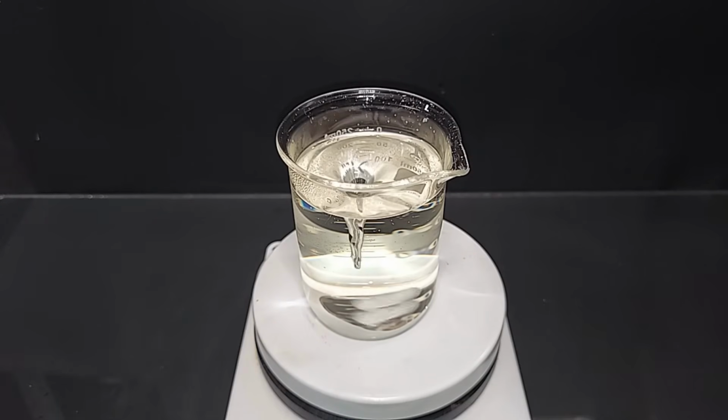I don't know if this comes through on the camera, but it's a slight yellow color, very slight, and that's because ascorbic acid does oxidize to dehydroascorbic acid when it's exposed to air and light, which is happening right now and has been for like the last 40 minutes. So I'm going to stop this, cover it up, and put it into a nice dark cabinet until I need it.